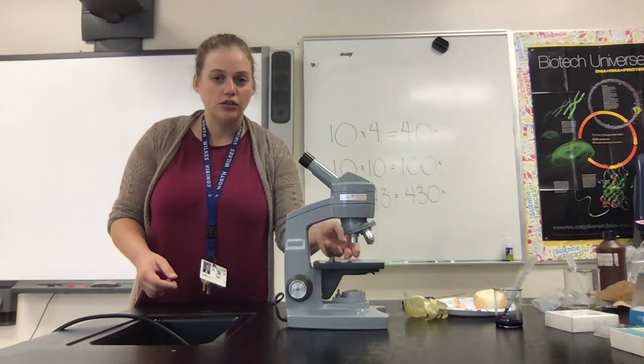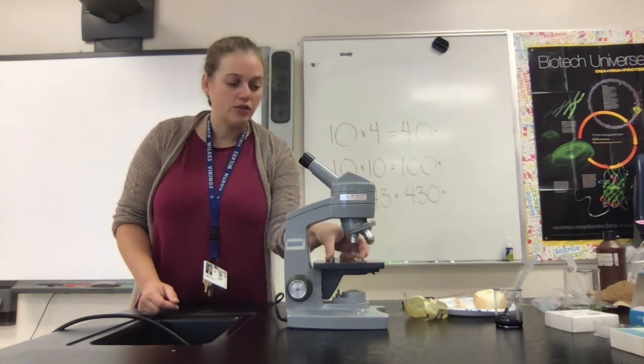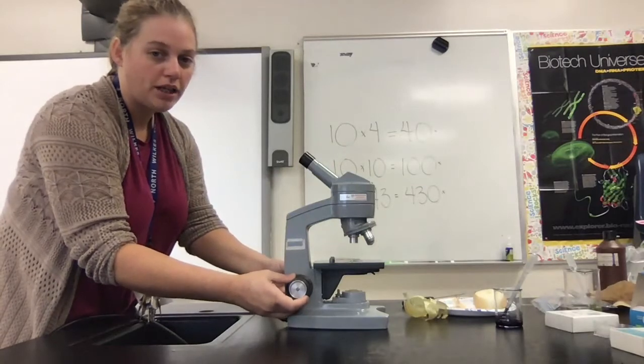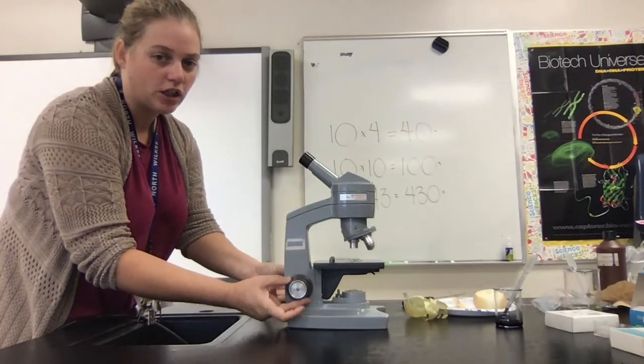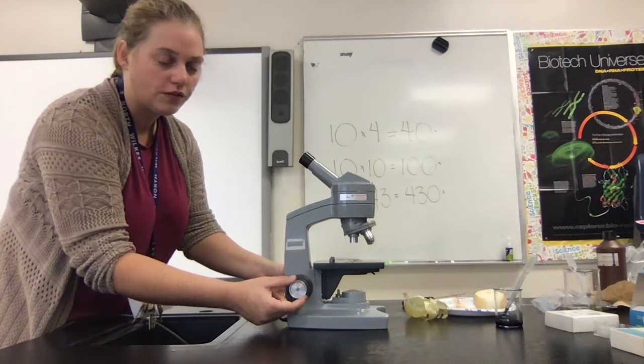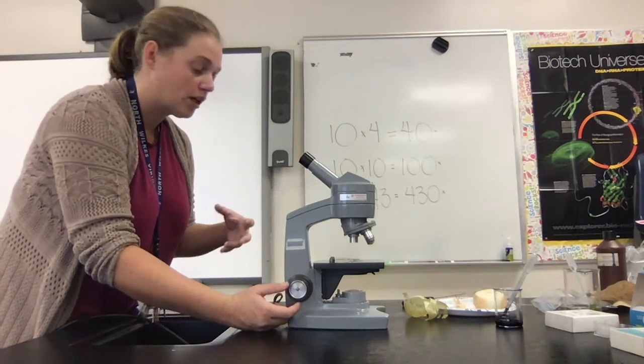When we need to focus on something, we're going to make sure that we have the lowest objective and it is as far away from the stage as possible. This is the stage — this is where you're going to put your specimen. We have stage clips which will hold the slide down. The big knob is your coarse focus, and it will move the objectives up and down. The small silver knob is the fine focus, and it moves the lens in the eyepiece so that we can get our specimen focused.